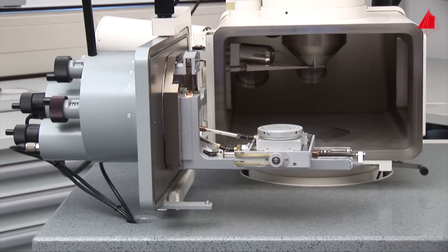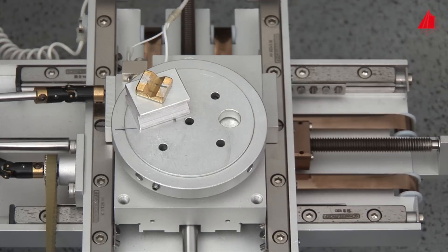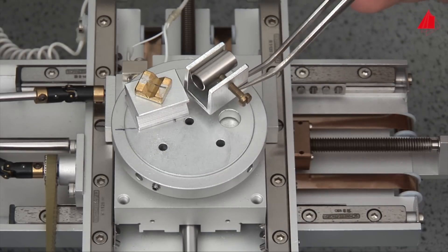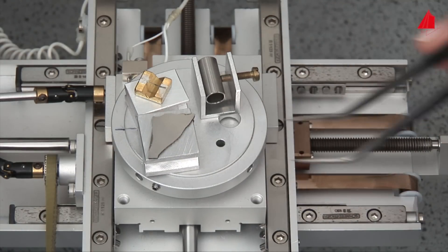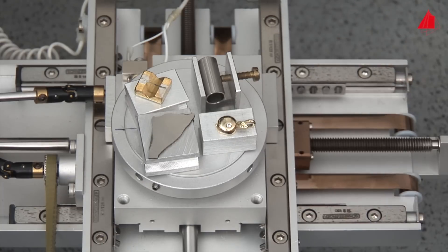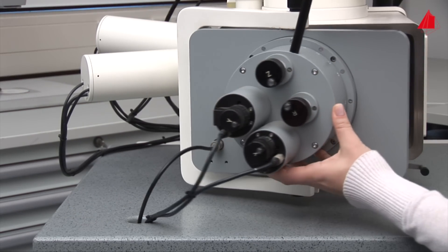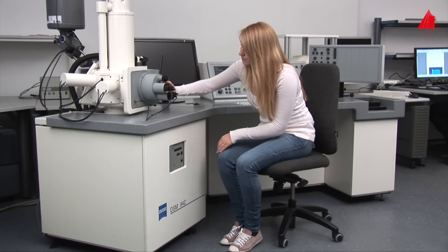Now different specimens can easily be placed on the round stage: the filament of an old used light bulb, part of a welded tube on a sample holder, a small cobalt plate, and a golden piece of jewelry. All specimens are assembled and we are ready to start. The material tester carefully closes the cover plate and switches on the two-stage high vacuum pump.